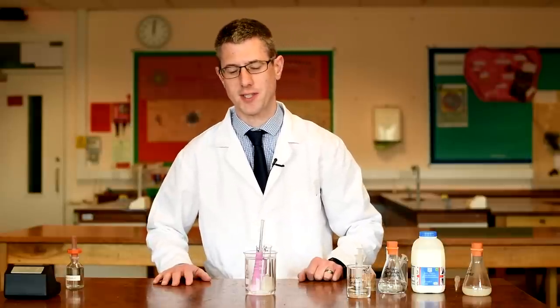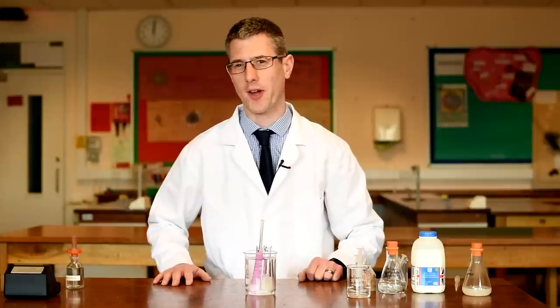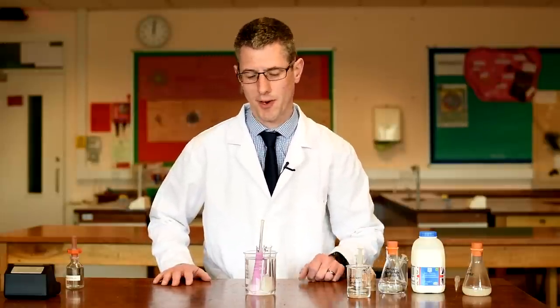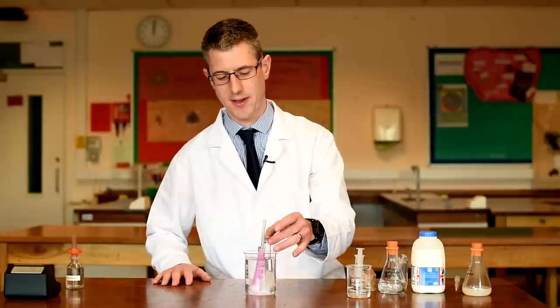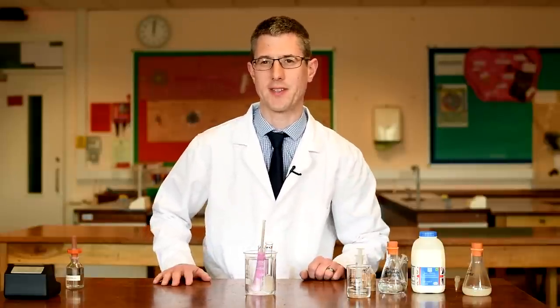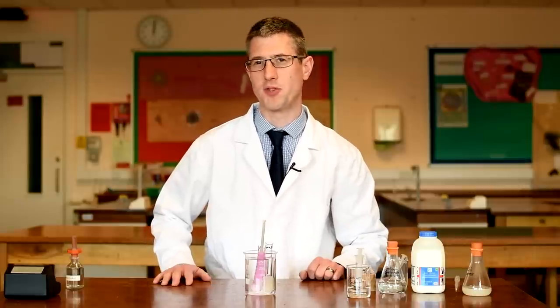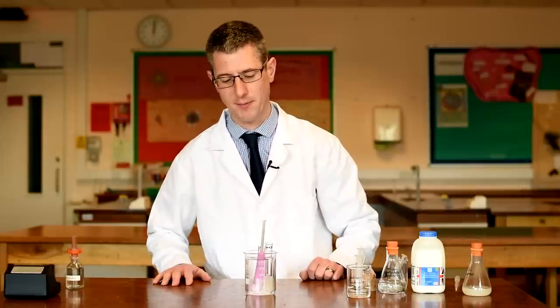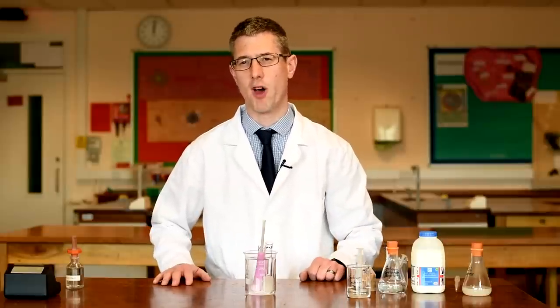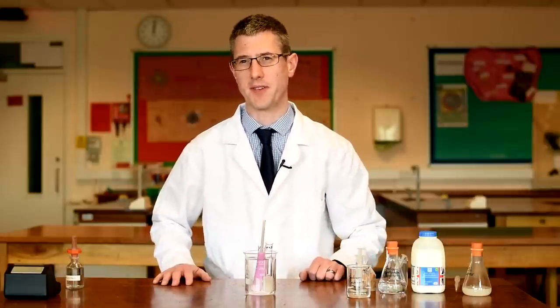There's a little bit of a shortcut in this experiment. If we used microbes it would take a lot longer, so instead of using microbes that are growing, we're actually using an enzyme — lipase — which is a model of the enzyme the microbes would be producing that would be breaking down the milk. So we're using enzymes directly rather than using microbes, just for speed.